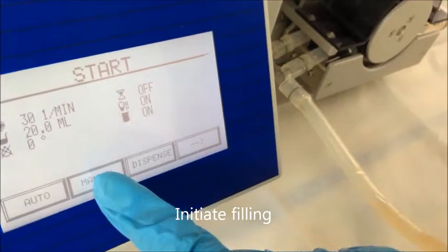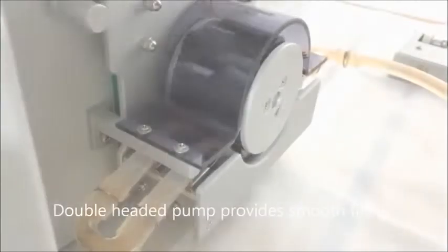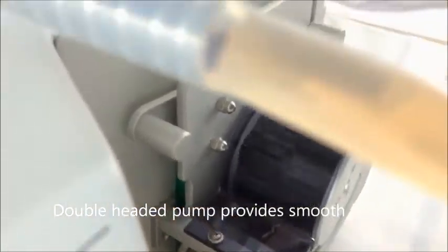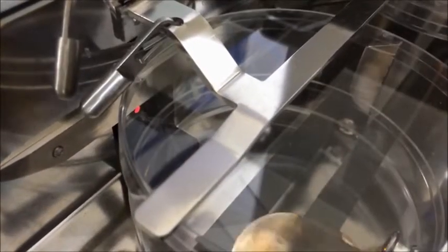Prime the tubing and then initiate the filling. The double-headed pump ensures smooth filling without any pulsation. The unit will fill each dish with the pre-programmed volume.